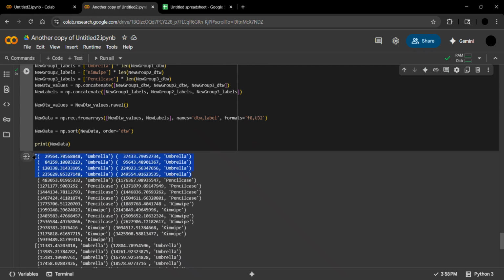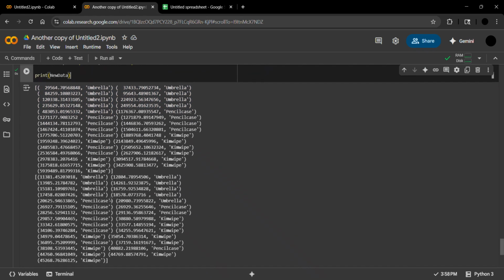And here we can show that the umbrella case was matched with the 9 previous data sets, which means that it's guaranteed to be matched. And again, we can see that it was matched after the Savitzky-Golay filter, although since the differentiation between the 3 samples is much easier than cotton and polyester, in this case the filter is not needed because the results are very much the same in terms of classification among the 3 samples.